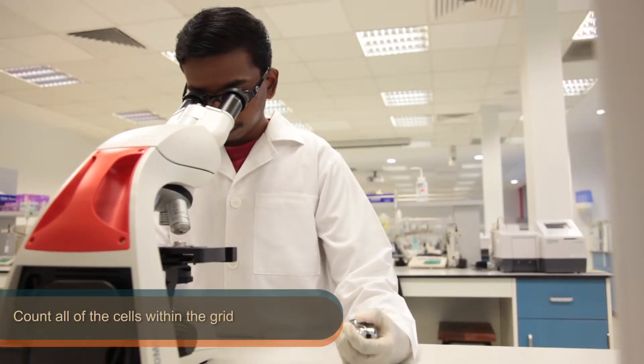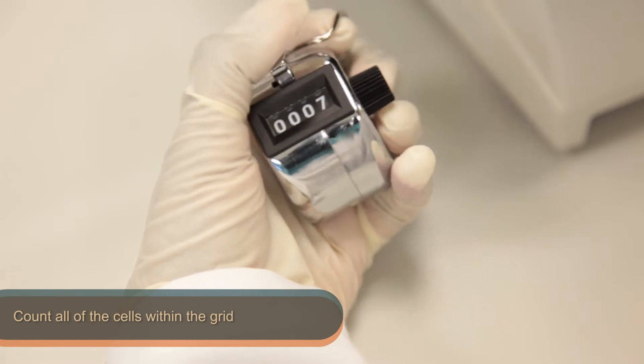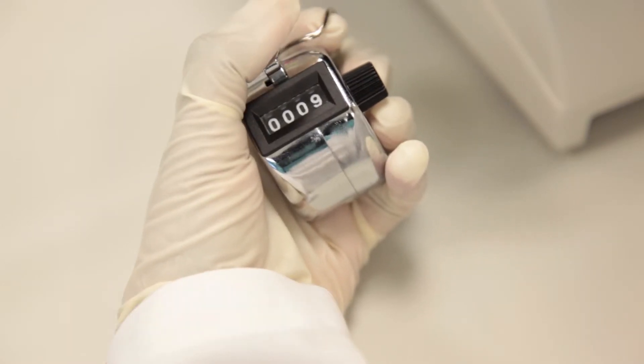Count all the cells within the grid. Ensure a standard way of counting to avoid counting cells more than once.